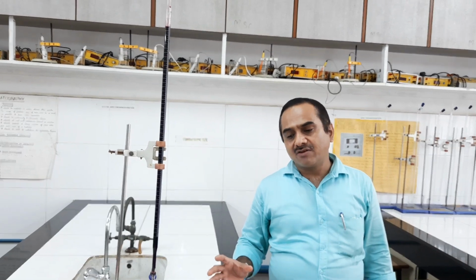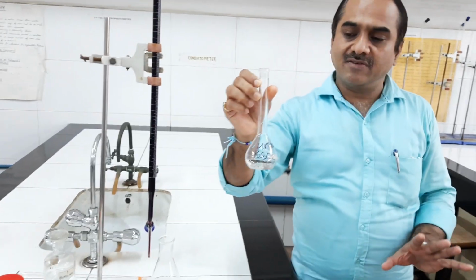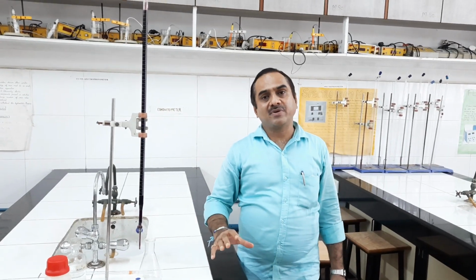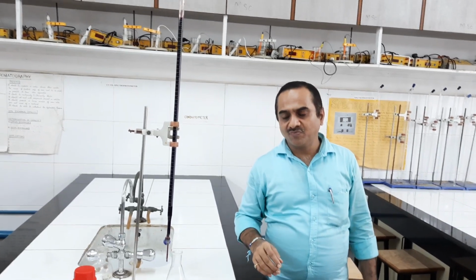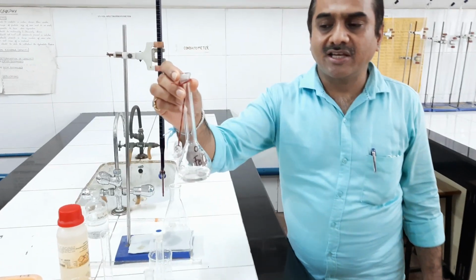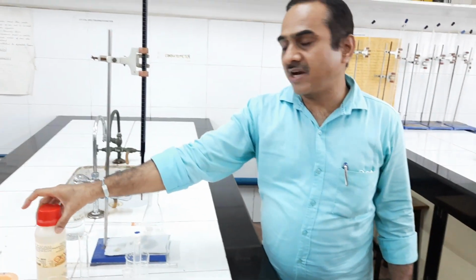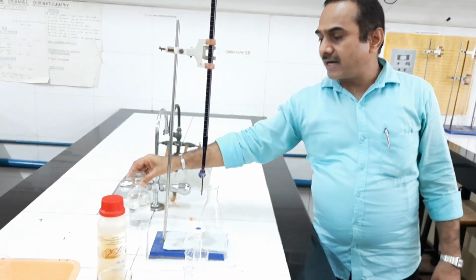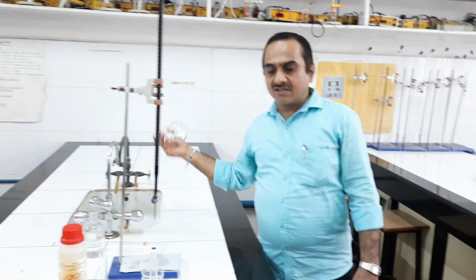In blank titration, we don't have to take sample solution. K2S2O8 solution is not to be taken. The rest of the solution has to be taken, and then that solution can be titrated against KMnO4 solution. Now, what are the other solutions? We have to take exactly 25 ml Fe2+ solution. Okay. Then phosphoric acid has to be added, sulfuric acid has to be added, and then we can titrate that solution against KMnO4 solution. Let us start this third type of titration.